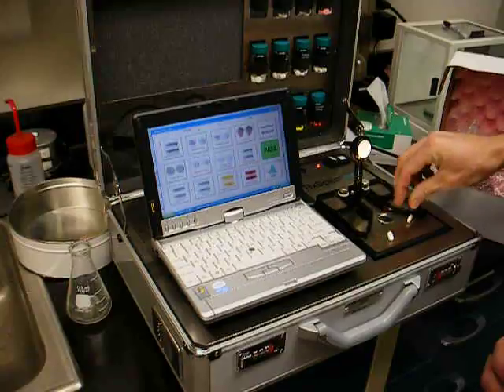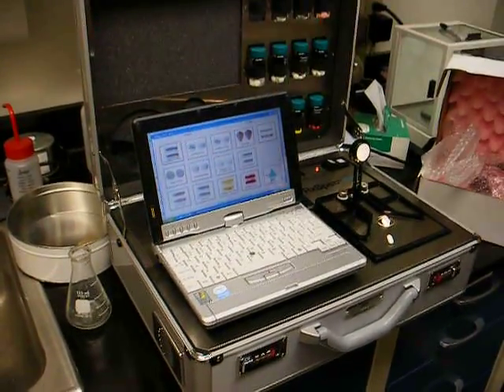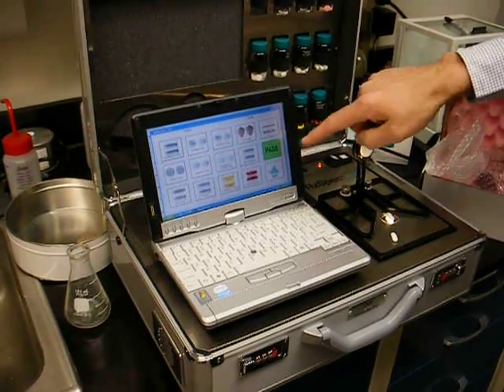To analyze a second sample, we just place the pill on the glass, press the appropriate button, and we've got a result again.